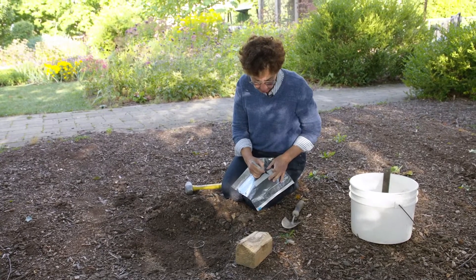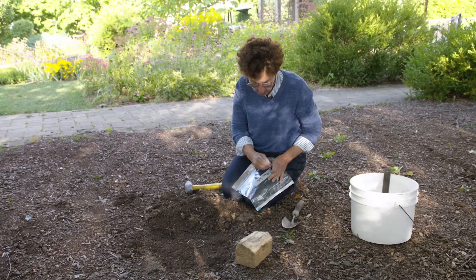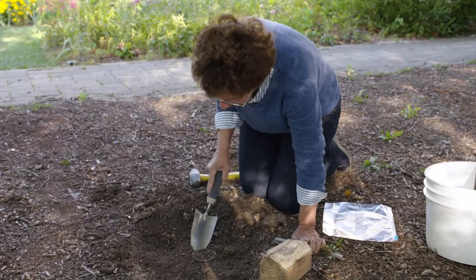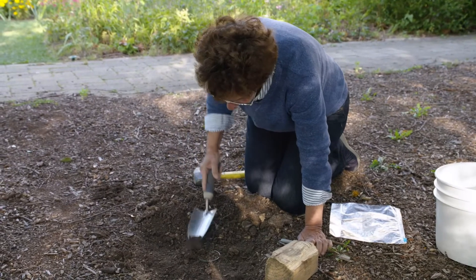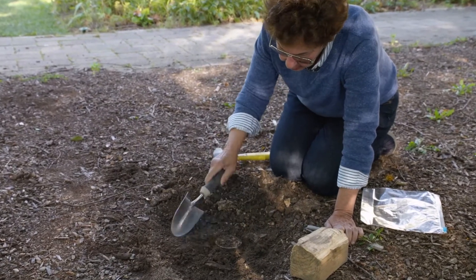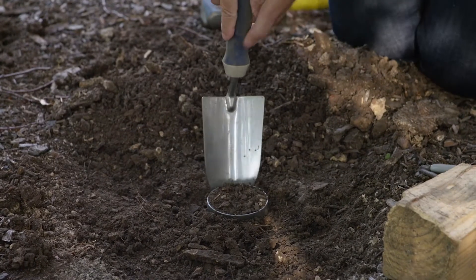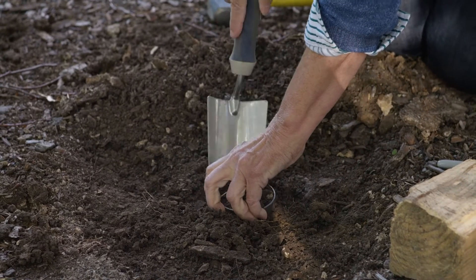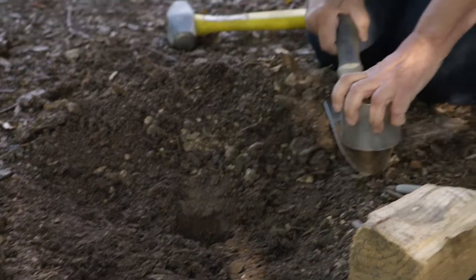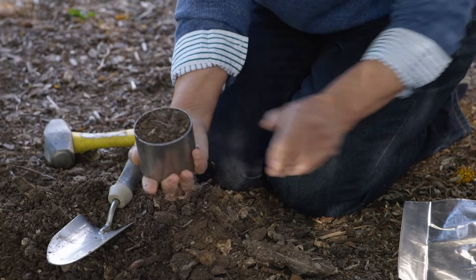It's always good to label — men's garden. Getting this out sometimes takes a little effort. You have to move around this cylinder. It's very dry, so it's making it harder. We can lever this a little bit. We want to make sure all the soil is in the cylinder. We put this underneath to make sure we have a known volume.